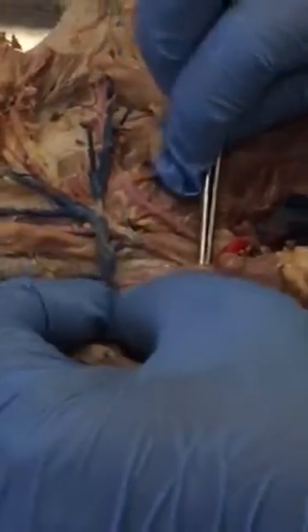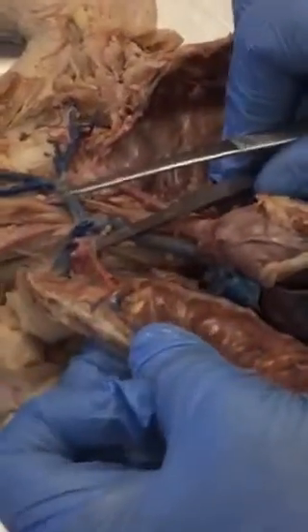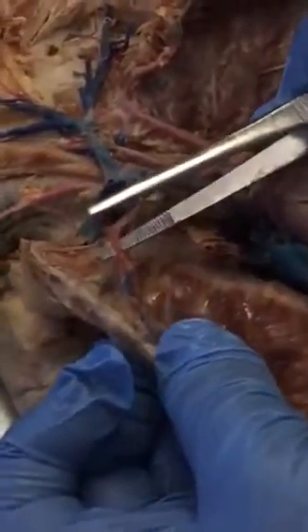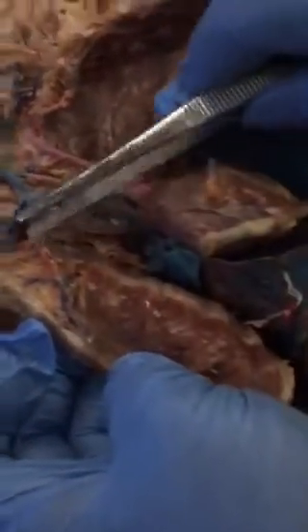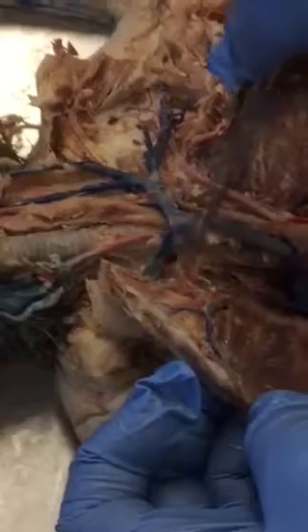Okay. If you look, you'll see that it branches two more times. This one becomes your right common carotid, and this one becomes your right subclavian. And it's right subclavian only until you get to the right internal mammary. See, the internal mammary goes to the breast. So the right subclavian is a short piece between right here and here. That's your right subclavian there.